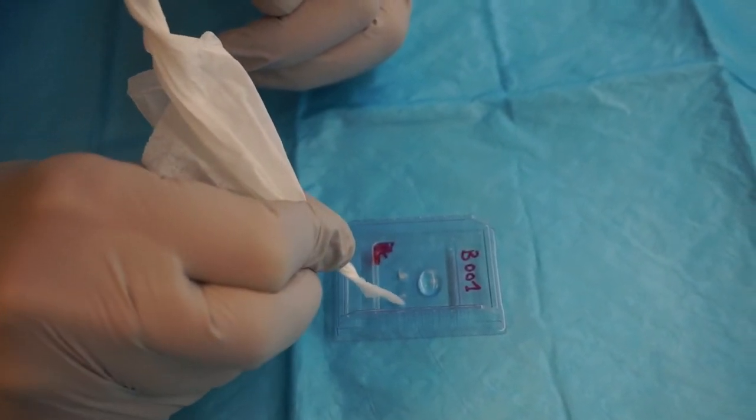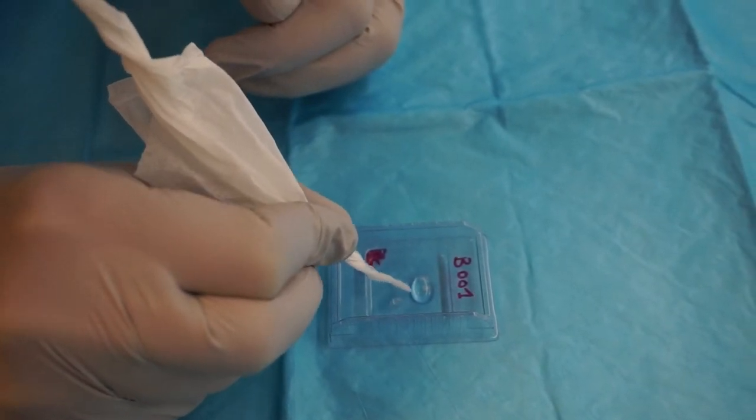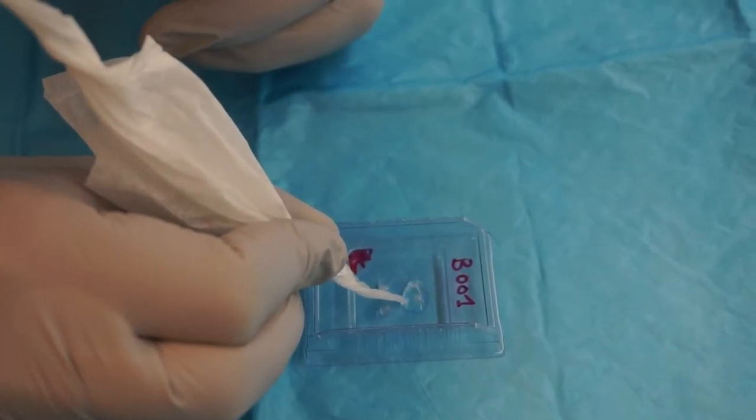If needed, the organoids can be moved very delicately. Excessive manipulation of the tissue will result in cracks.